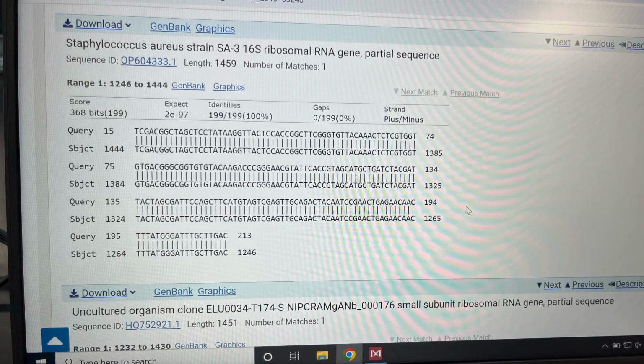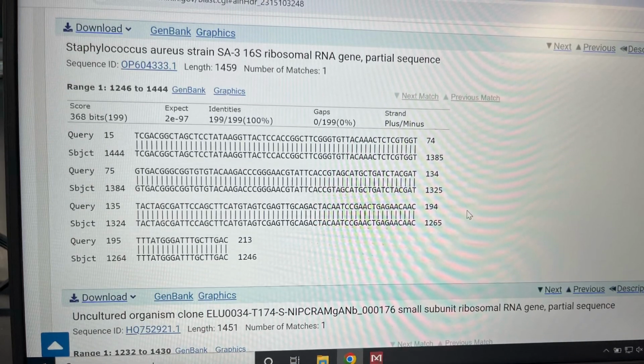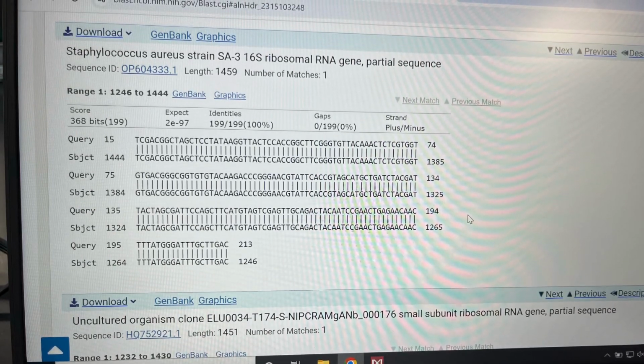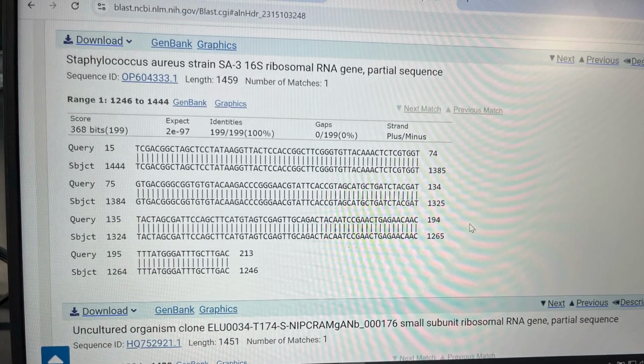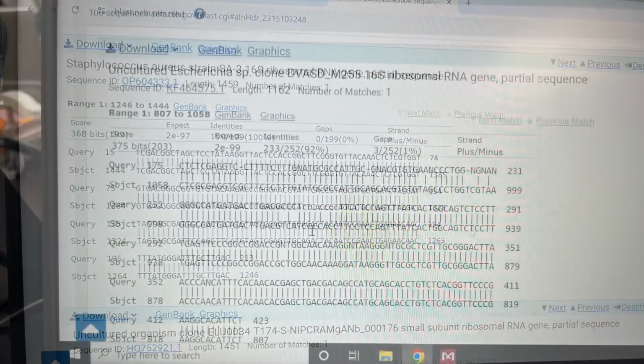And if you see too many of these, or if your chromatogram fades away after 30 or so base pairs, your sequence may have failed. Otherwise, check your N and make sure you can call the base as A, C, G, or T.